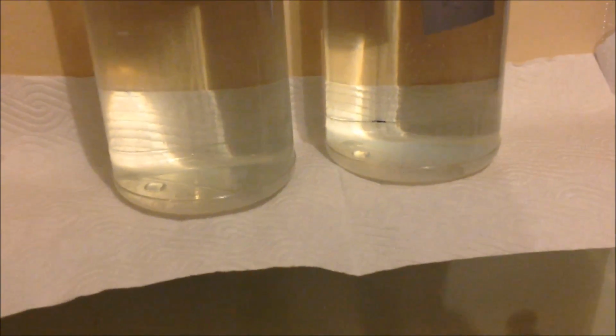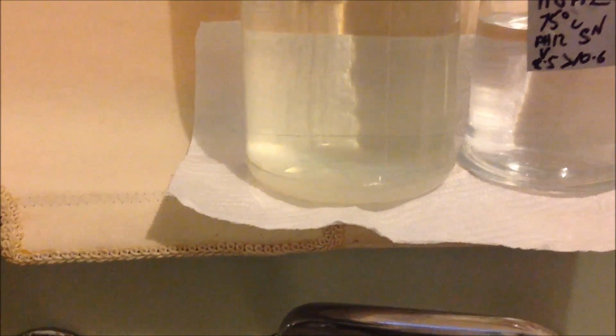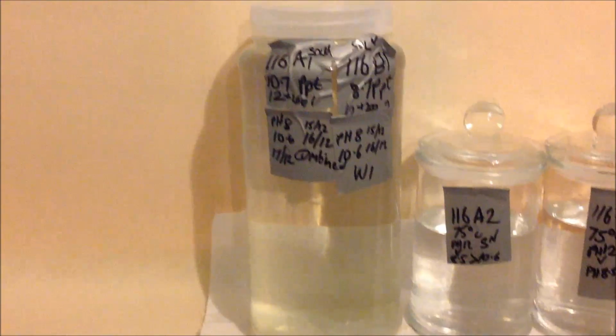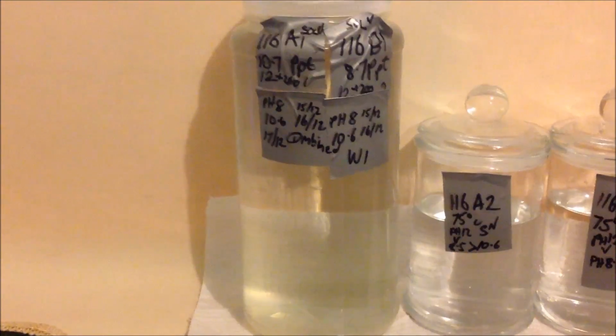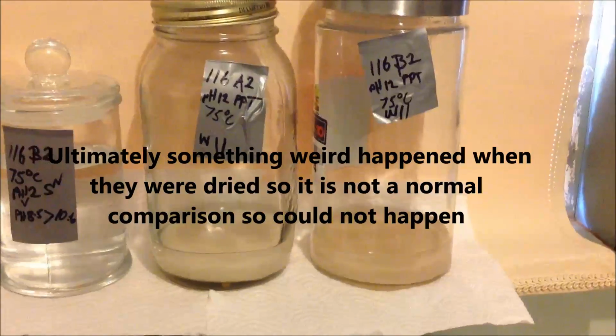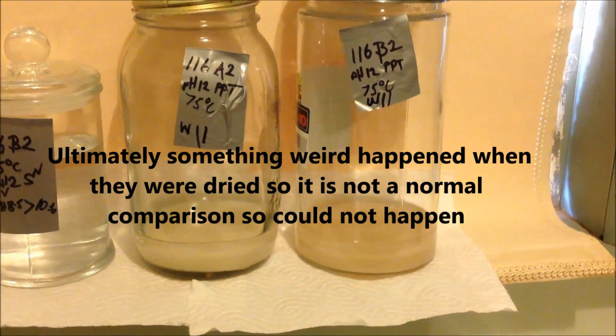So I've got so little of it, what I'm inclined to do is to rack them off into the same sample and try and compare this precipitate with the other one, and best hope of learning something from that. Precipitate, which has now been combined because they both looked identical and was about the same amount, and once dried, if we go that way, then it would be too small an amount on their own to compare. So I'll carry that forward and compare with the precipitate that is still remaining from the beginning.